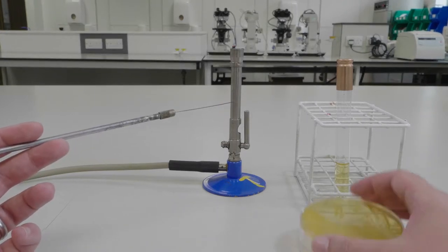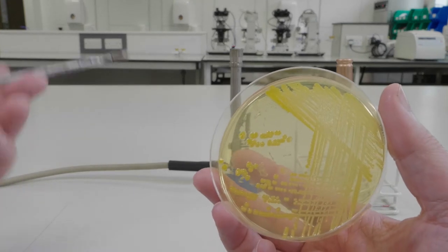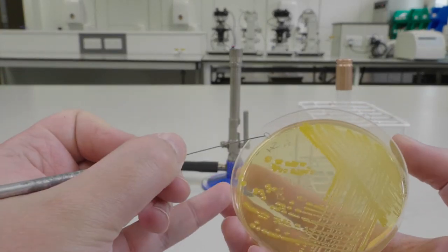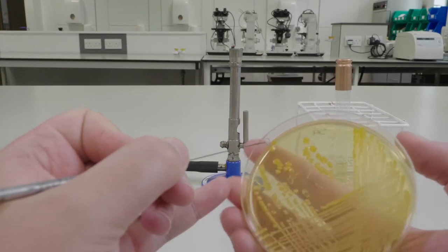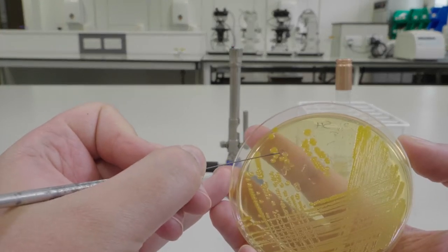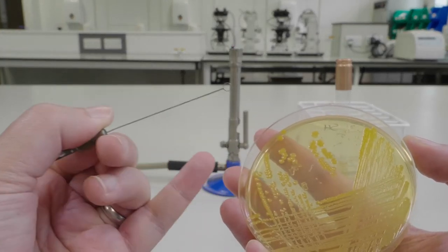Pick up the part of the plate containing your bacterial culture. You can leave the lid of the plate on the bench and, holding your inoculating loop like a pencil, collect a small sample of bacteria from a single colony.